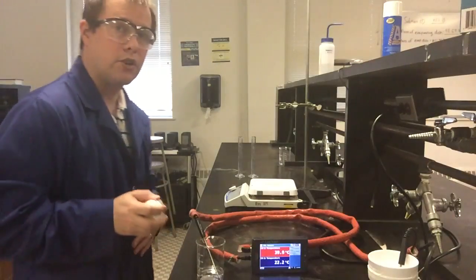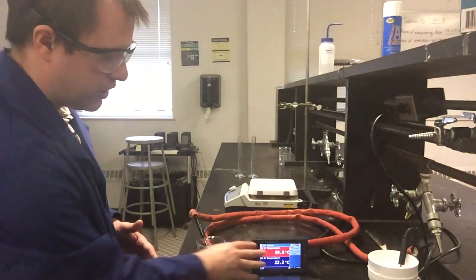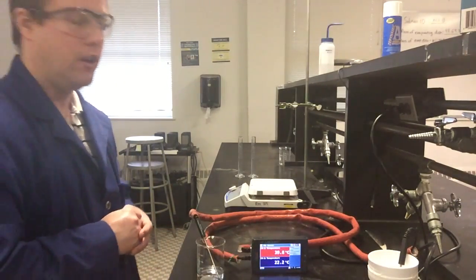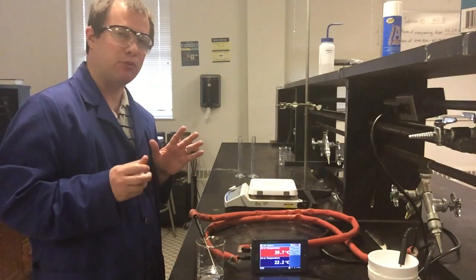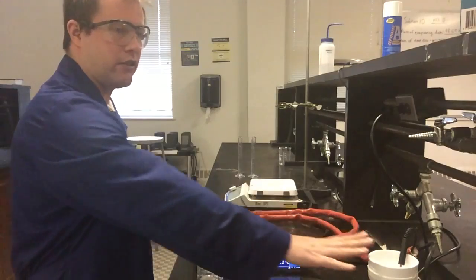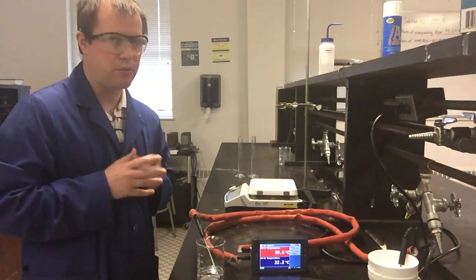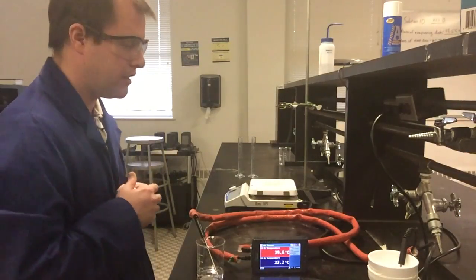Alright, so at this point, I've heated my water up to 40 degrees. I've taken it off the hot plate and am letting it cool down. I see it just got under 40 degrees now, which is what we wanted. We wanted to start somewhere between about 35 and 40 degrees when we start collecting data. You see I have right here a cold water solution. Here I have my hot water solution, roughly about 50 milliliters of each. Again, I'll have the exact data at the end.